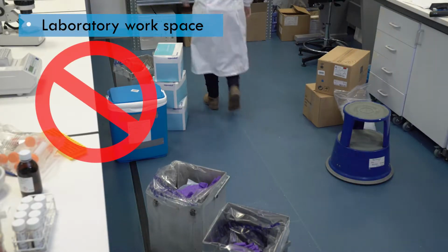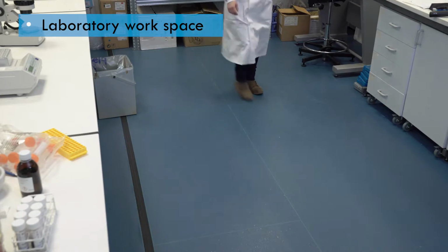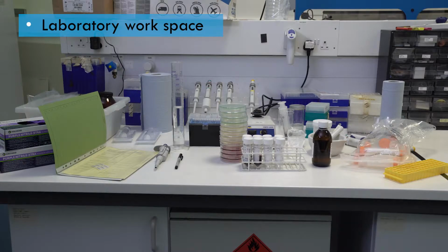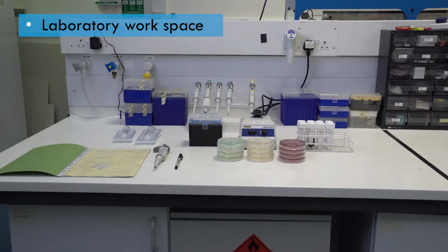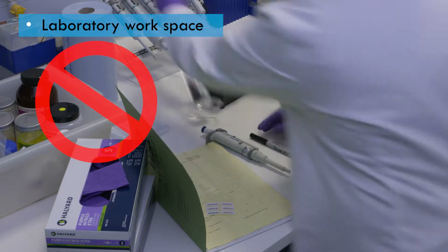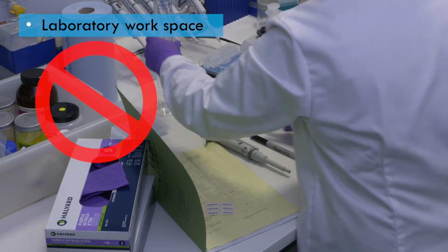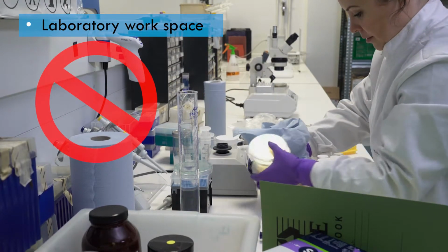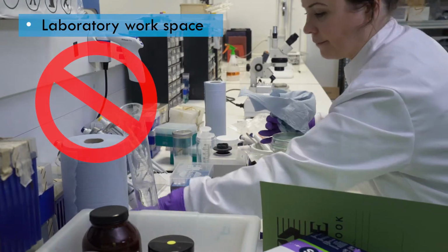Floors should not be used as storage areas and should be kept clear of everything, except waste bins if they're needed. Before starting work, the workspace should be clean and tidy. If possible, keep the surface clear of everything except the items needed to complete the task at hand, and keep these items towards the back of the bench to ensure you have enough room to work at the front. It's difficult to work well in a messy environment. It can lead to cross-contamination and accidents, which may expose laboratory staff to biological agents.